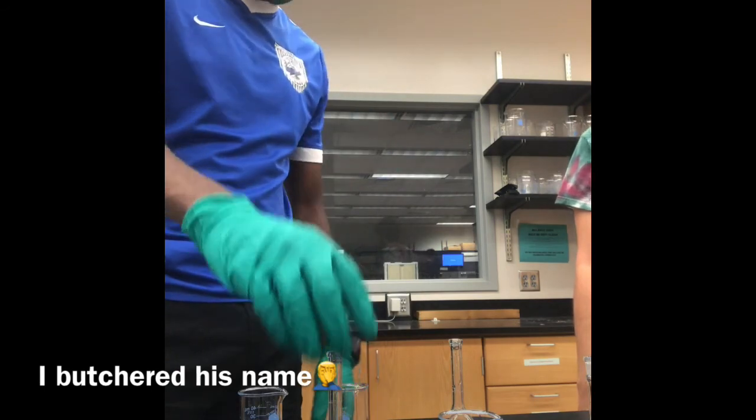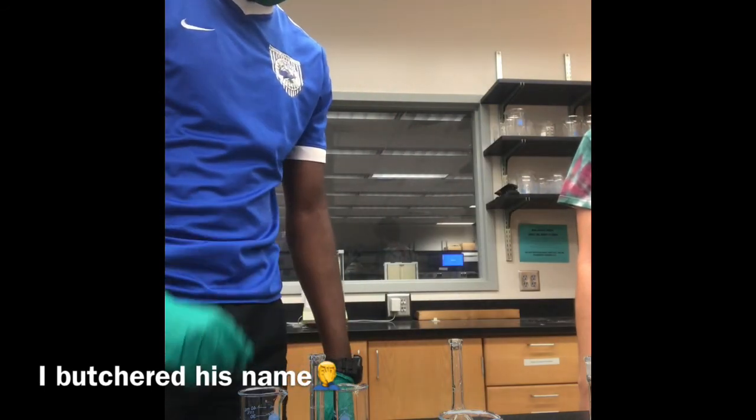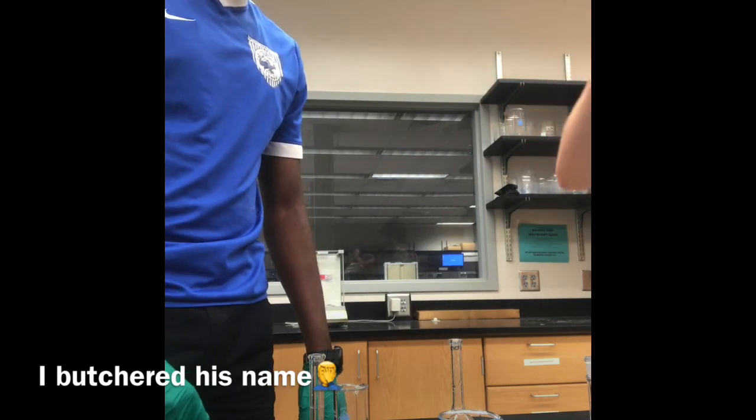And here Shaw, the TA, is teaching me the correct equation and how to calculate it. Is that the one that you were working on? And that's how dilution works. You do this 3 times, and then at the end you would get 4 solutions.